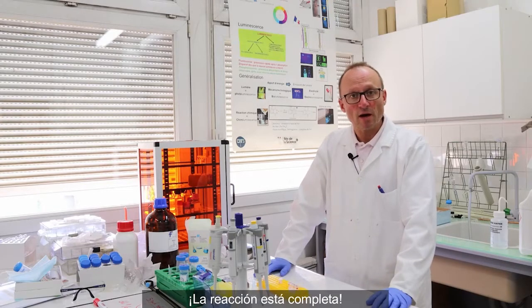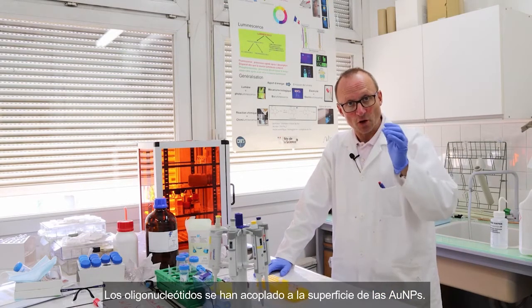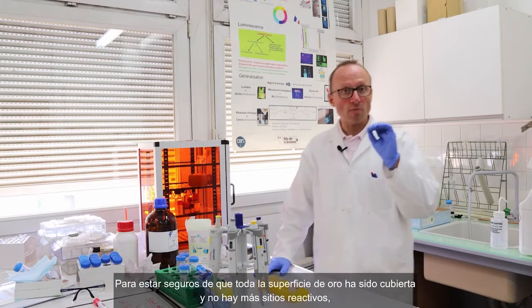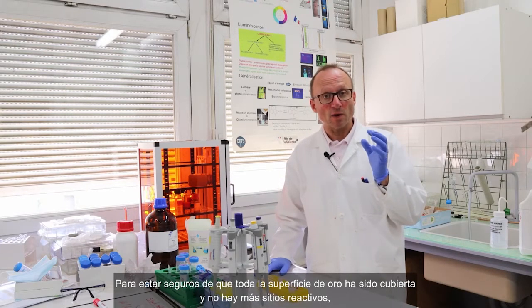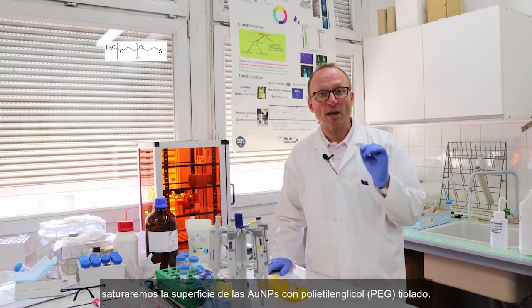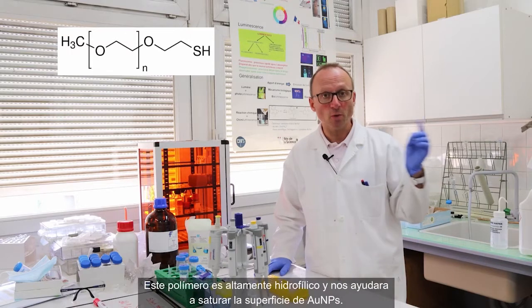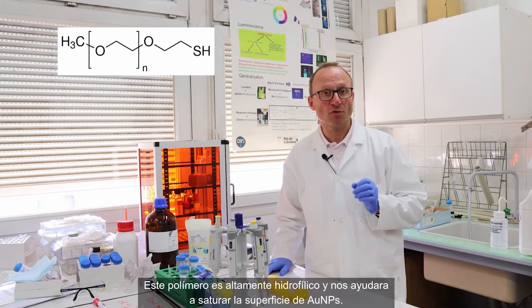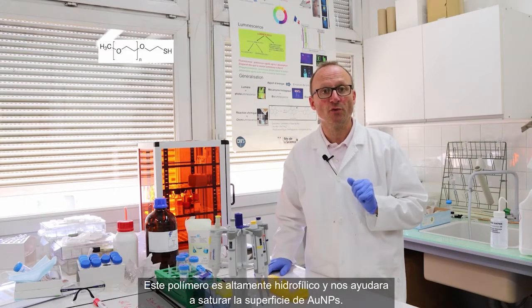So the reaction is done now. The oligonucleotides have been coupled on the surface of the gold nanoparticles. And just to make sure that all the gold surface has reacted and will not react anymore, we'll saturate this gold layer with a solution containing PEG thiol. PEG means polyethylene glycol. This is a long polymer which is highly hydrophilic and that will help in the saturation of the gold nanoparticle surface.